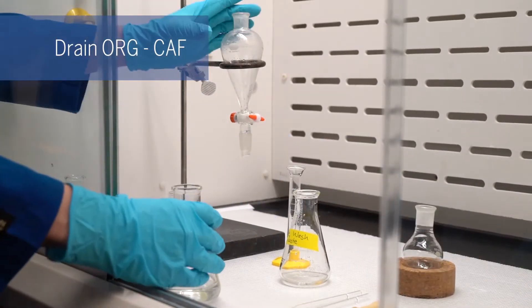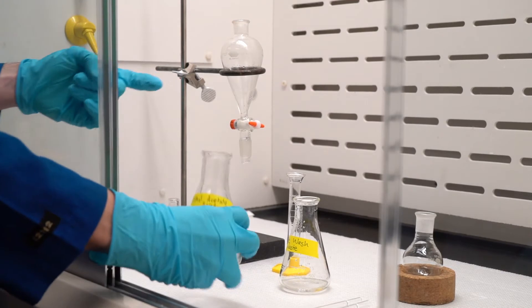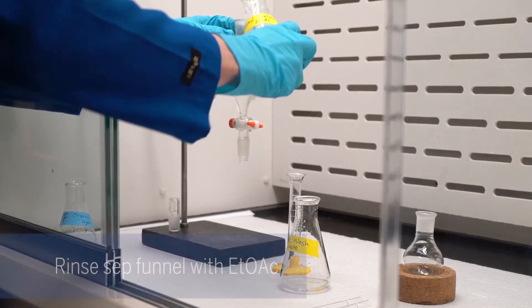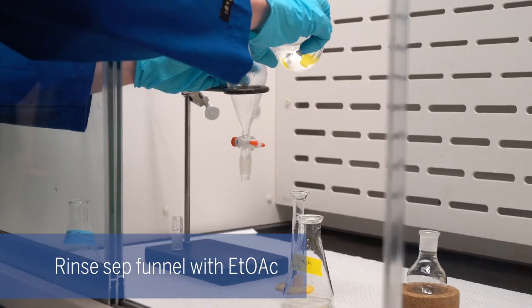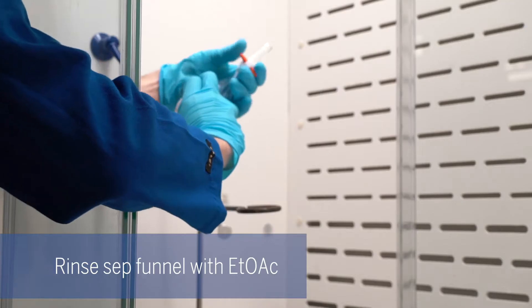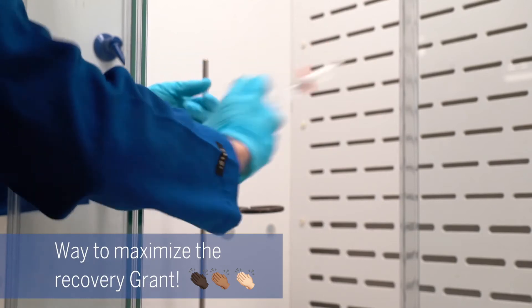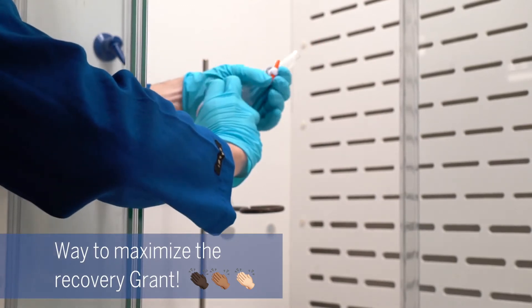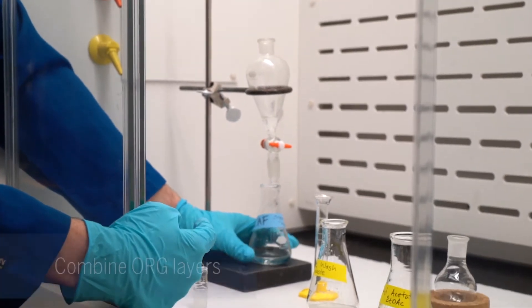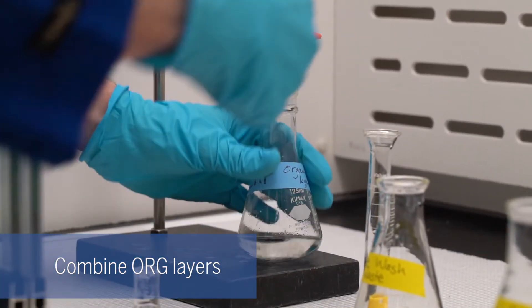There might still be some caffeine trapped on the walls of this vial, so we're just going to rinse it down one more time with some additional ethyl acetate — about 5 to 10 mils. Here I'm shaking a little more forcefully because I want to get as much off the walls of the sep funnel as I can. Then we're going to drain that into the same Erlenmeyer with the same fraction of ethyl acetate from before.